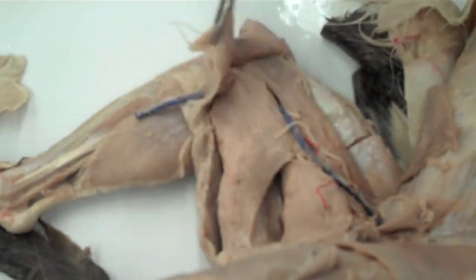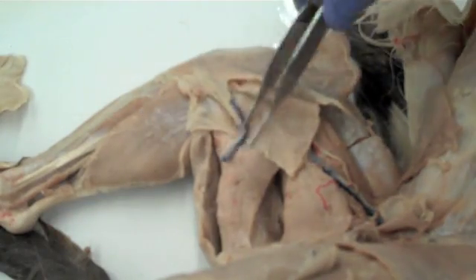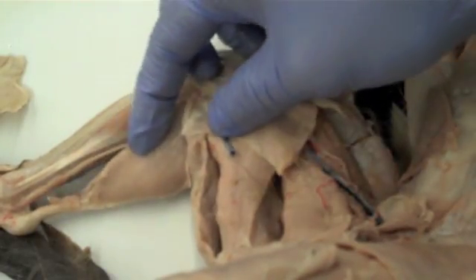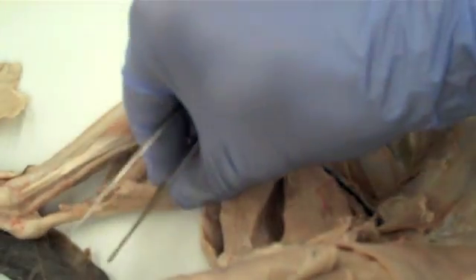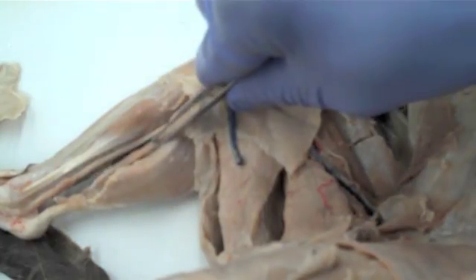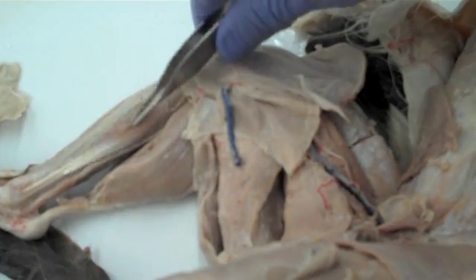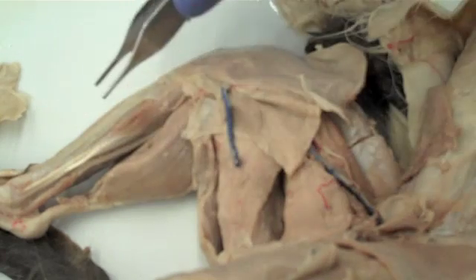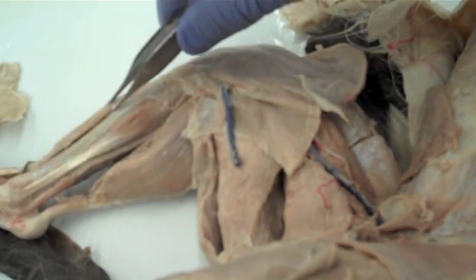Lastly, the muscles of the leg visible on the medial surface. We've got the calf muscles — both the gastrocnemius here, and if we peel away we can find the soleus muscle right there. Also visible on the medial surface we have the flexor digitorum, and you can see its tendon, as well as the tibialis anterior, which is also visible on the lateral side.